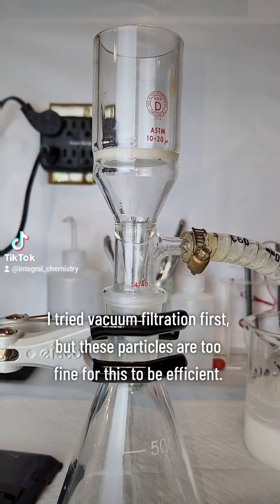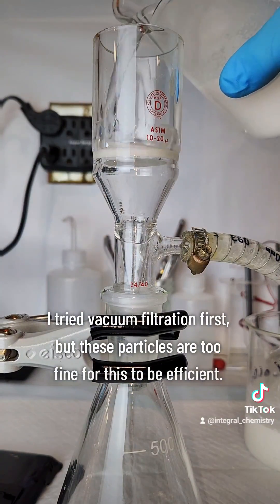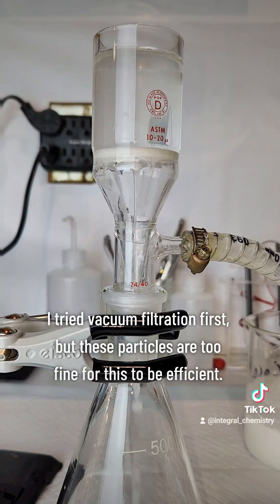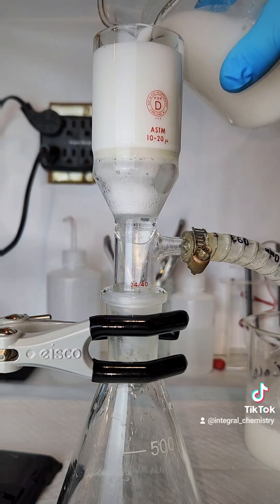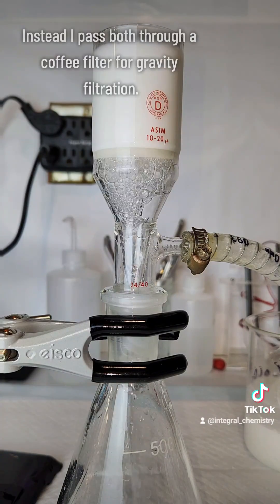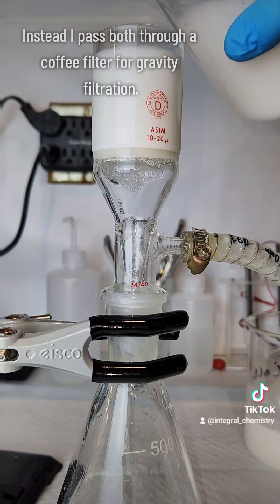Anyway, I first tried vacuum filtration to isolate my product, but calcium sulfite and carbonate form extremely fine particulate in solution that's really hard to filter off. They both kind of just gummed up the vacuum filter.